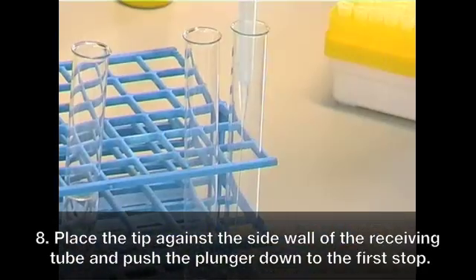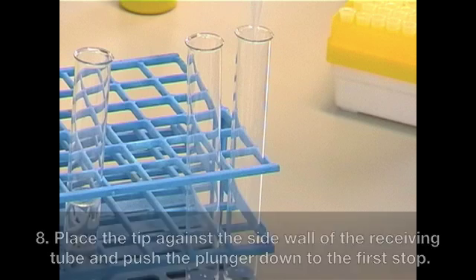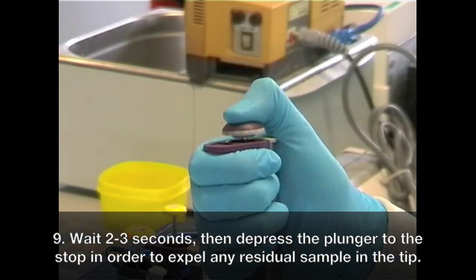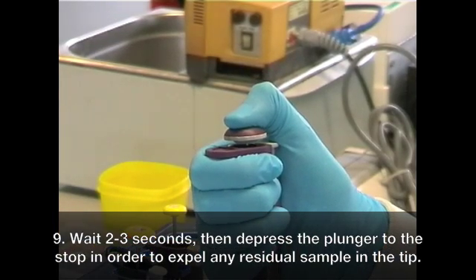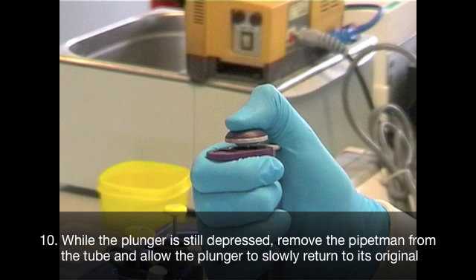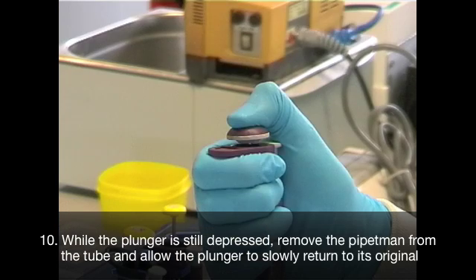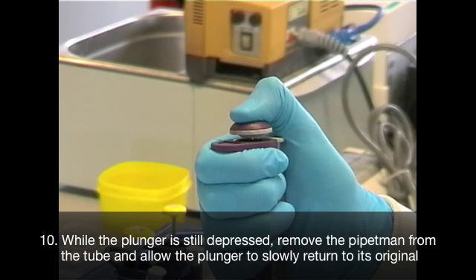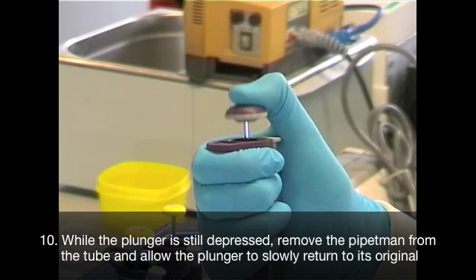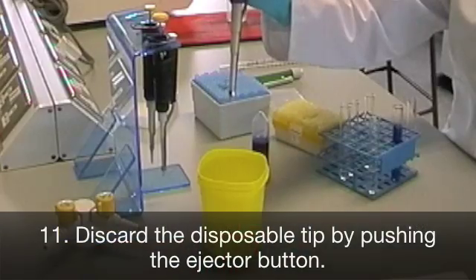To dispense the sample, place the tip against the side wall of the receiving tube and push the plunger down to the first stop. Then wait 2 to 3 seconds and depress the plunger to the second stop in order to expel any residual sample in the tip. While the plunger is still depressed, remove the pipetman from the tube and allow the plunger to slowly return to its original position. Finally, discard the disposable tip by pushing the ejector button.